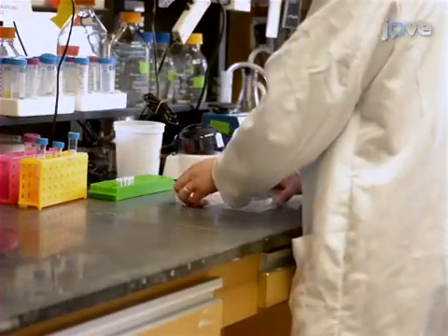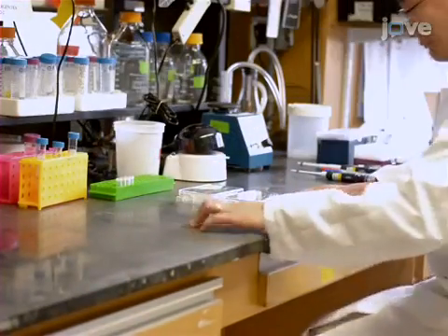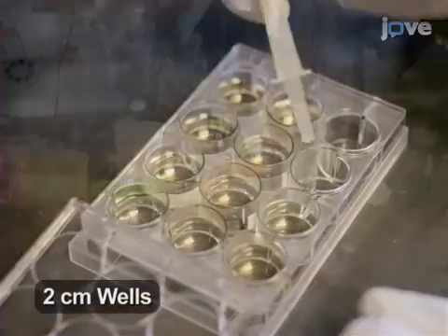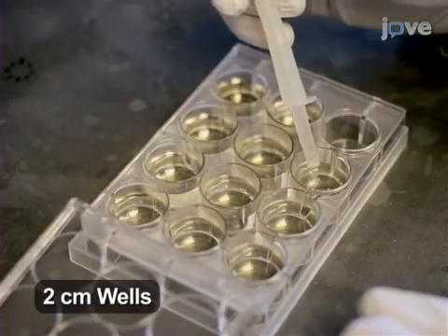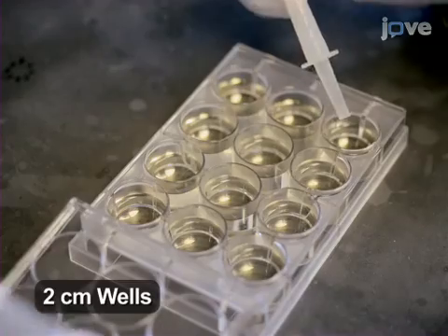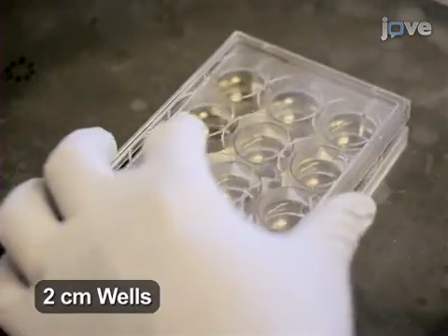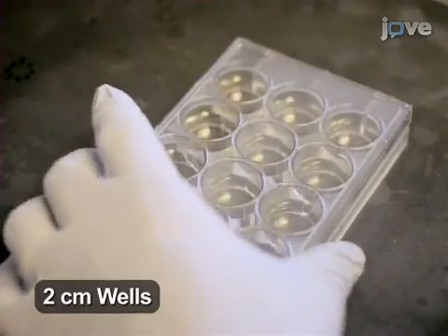Have ready a drug of interest with a known working concentration. Begin by loading a 12-well plate with 2ml of NGM medium per well. Set the plate aside to harden at room temperature.